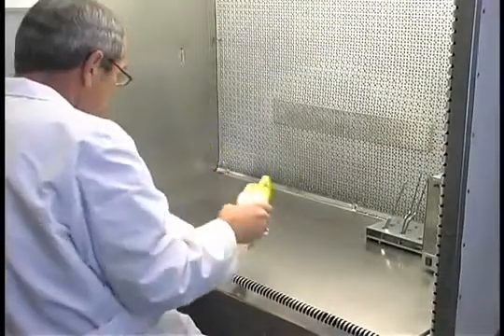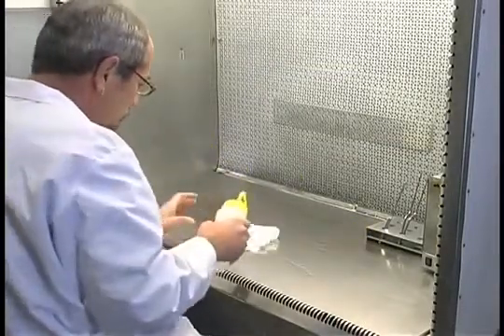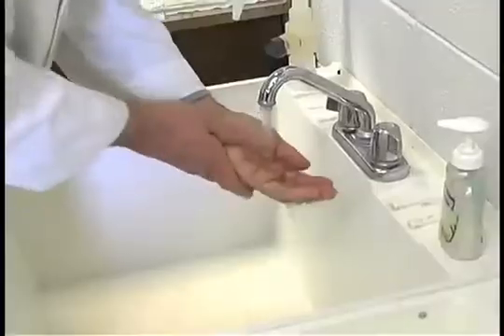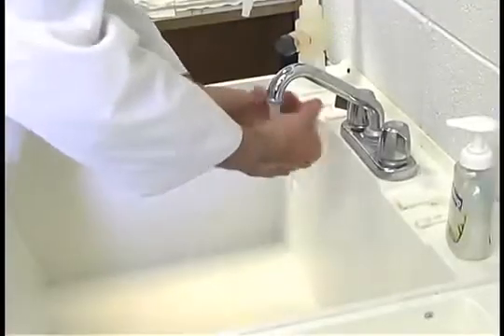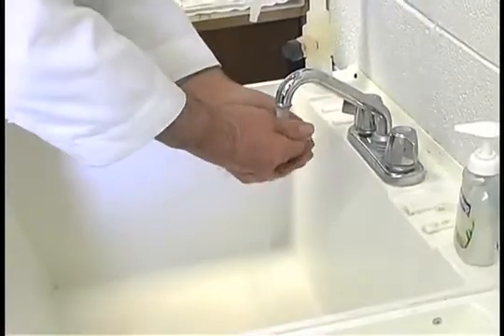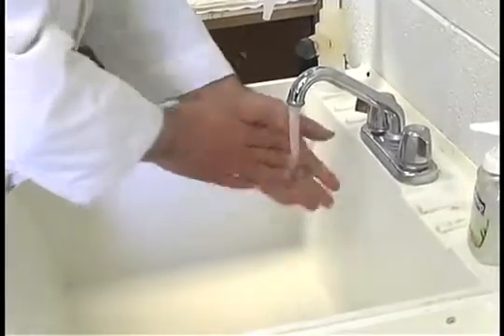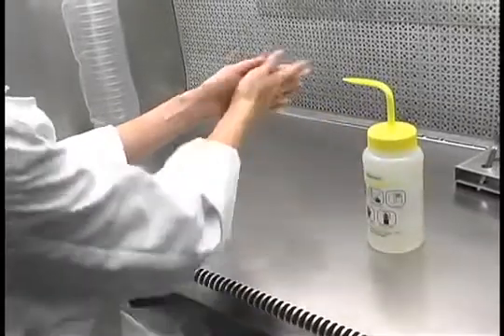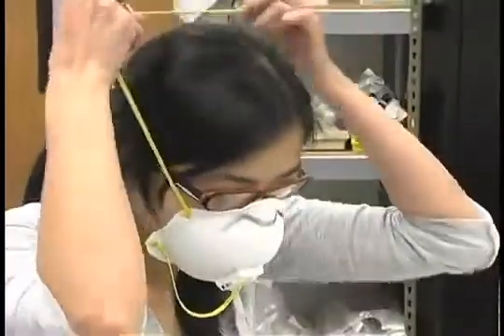You should always be aware of potential sources of contamination such as dust, hair, hands, and clothes. All jewelry should be removed, hands washed, sleeves rolled up, and long hair tied back. Hands should be washed, not scrubbed — scrubbing dries hands and creates flakes of skin that have bacteria — and sprayed with 70% ethyl or isopropyl alcohol, or coated with isopropyl alcohol gel. Gloves and masks provide extra protection.